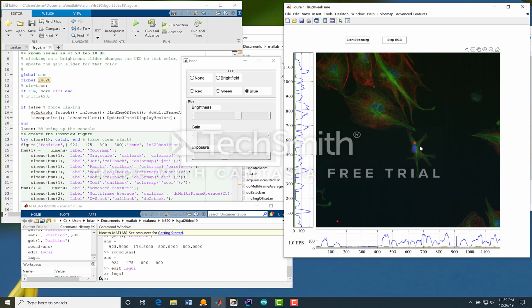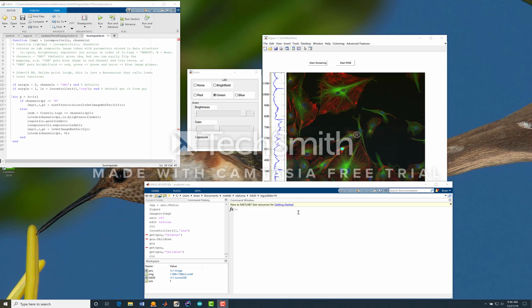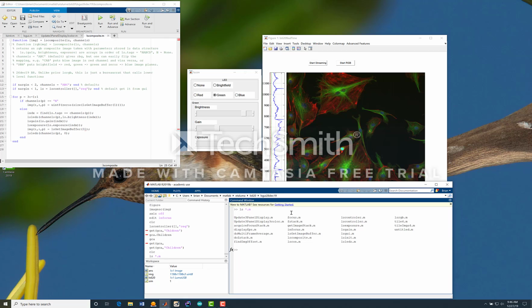So these individual graphics windows, you can see that they have various attributes to them that they just inherit from being in the Matlab environment. Let me take you under the hood a little bit. ls star.m. These are the M files that are running the show.